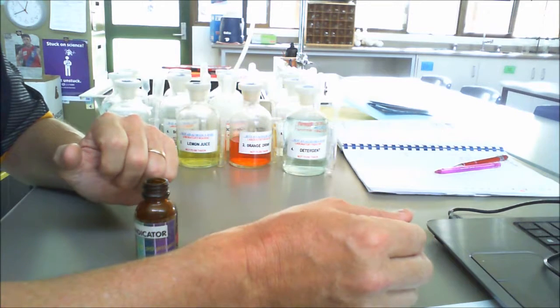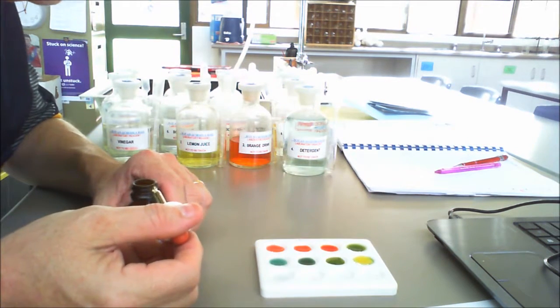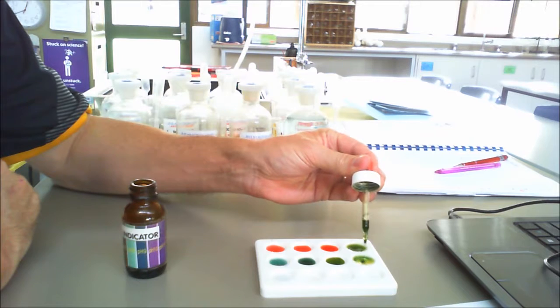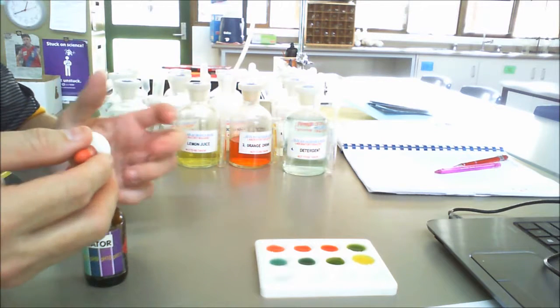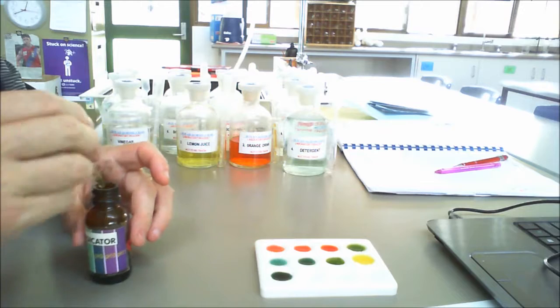We've now got bleach, and again bleach is the same story. It goes blue on the outside, as you can see there, and then it starts to go yellow, so you can see the blue that is occurring there to begin with, so we would call that a blue. For toothpaste, blue once again.